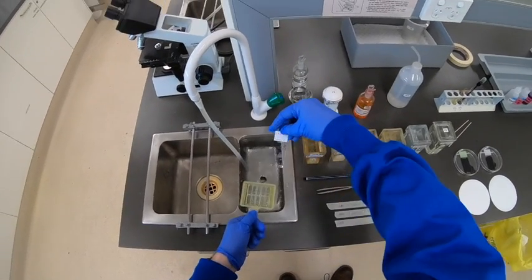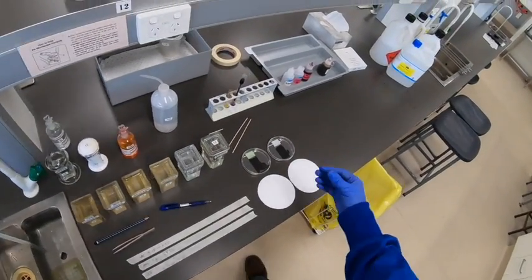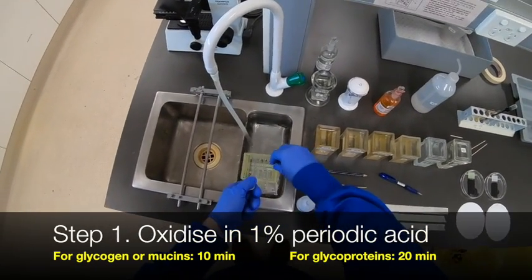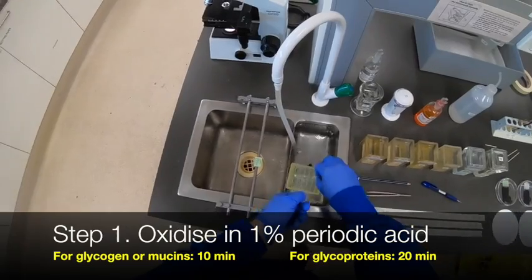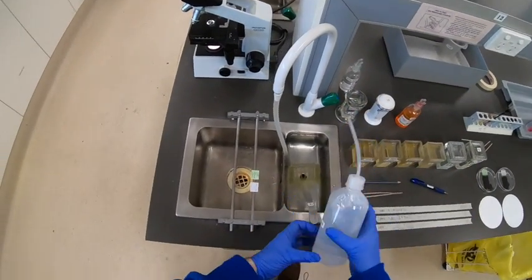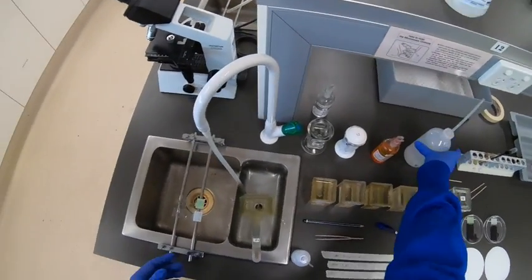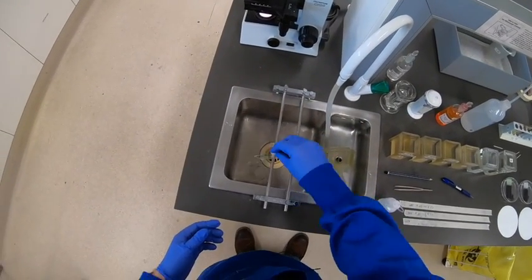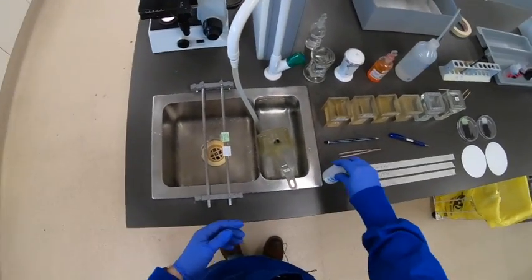Here we have two slides that have been taken down to water for the purpose of staining with the PAS method. The P stands for periodic acid, an oxidizing agent, and we'll be applying that to a section of liver and a section of kidney. Just give these a bit of a rinse with deionized water — it's less critical at this point, but since there are chemical reactions taking place it doesn't hurt to have something fairly clean on the slide.